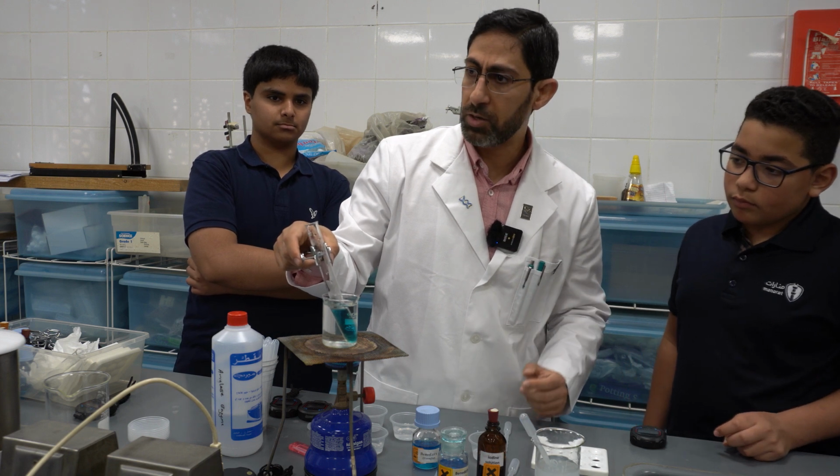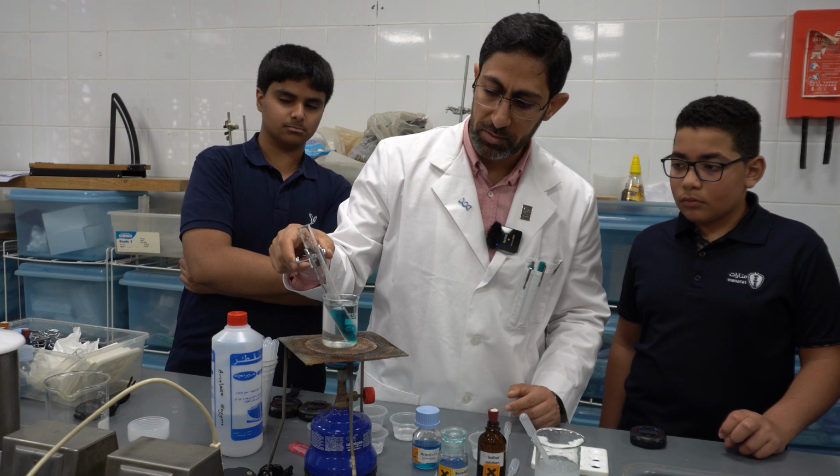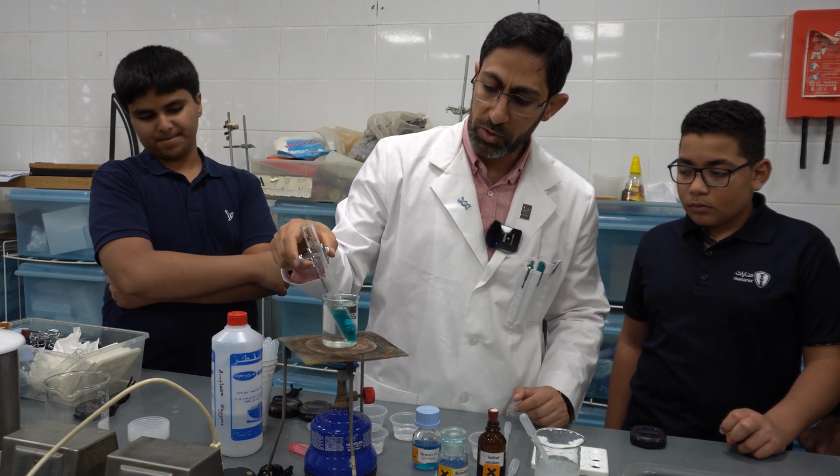If you'd like to go to your classes, you are free to go. I will just take a couple of seconds. It starts to react. You can see the color will start to change.